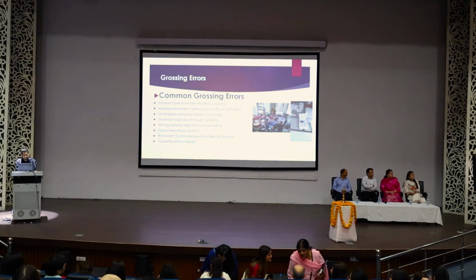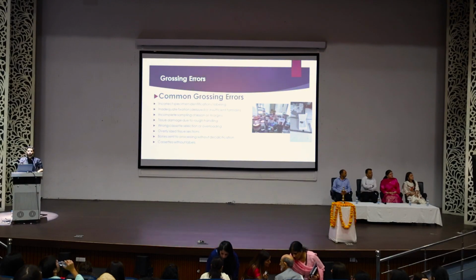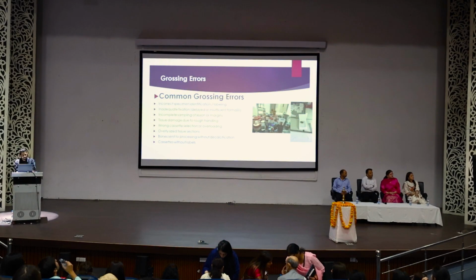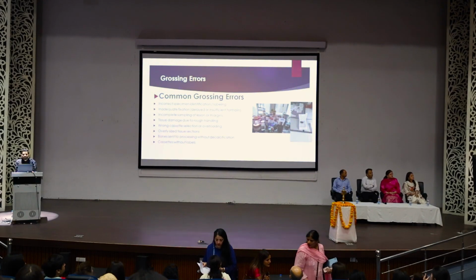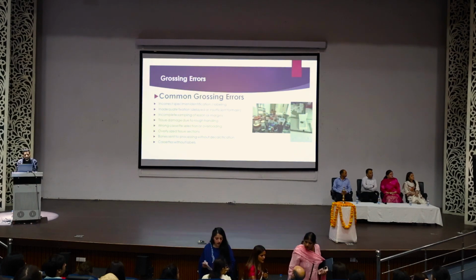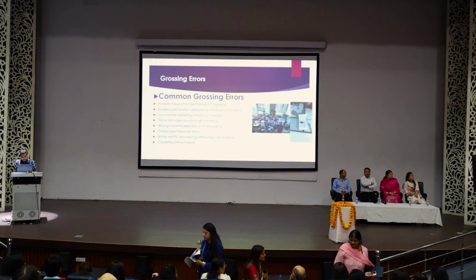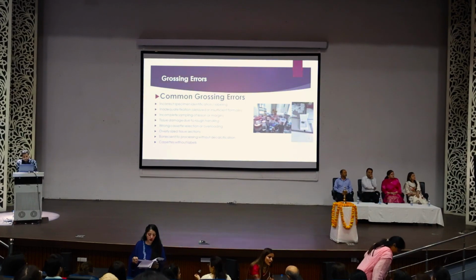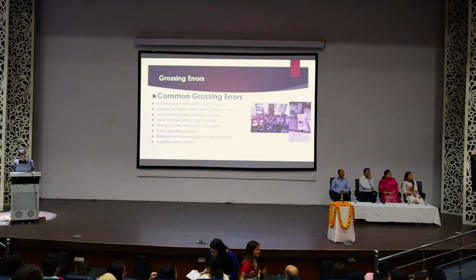Wrong cassette selection or overloading. As we have color-coded cassettes in our labs, you need to be sure which color to use for which tissue. And also you need to be sure to not overfill the tissue, especially in resected prostate. We sometimes find a very, very overloaded cassette. Sometimes if the cassette opens in processing, we may lose all the tissue pieces.